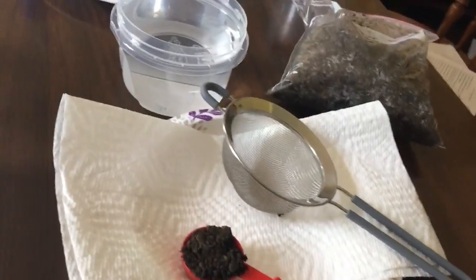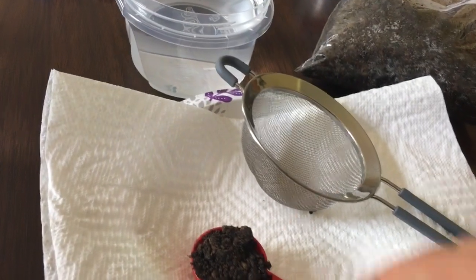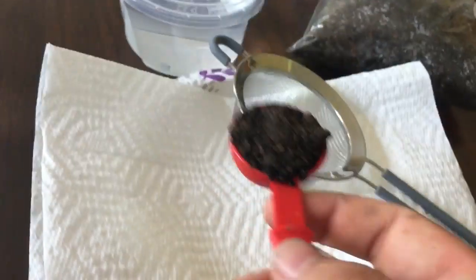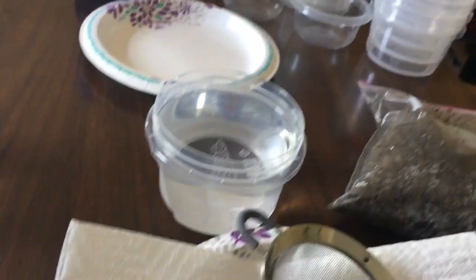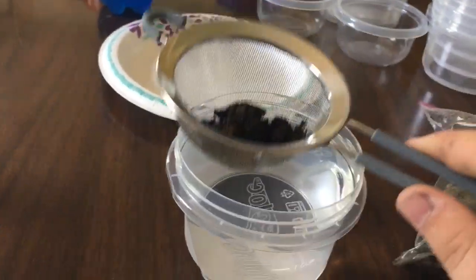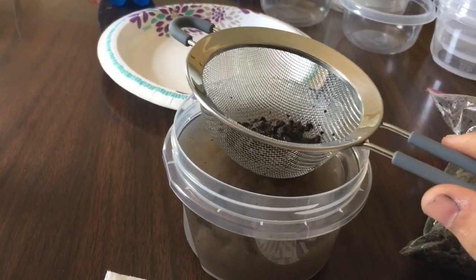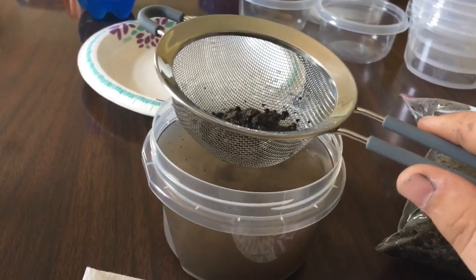So for today's experiment, I am comparing forest and field soils. This experiment will go over the aggregation and aggregates in the soil itself. I am to put 15 grams, or just over a tablespoon, of the soil into the strainer, and then dunk it to make it moist, and dunk it about 20 times at 2 seconds per time. So here we go.